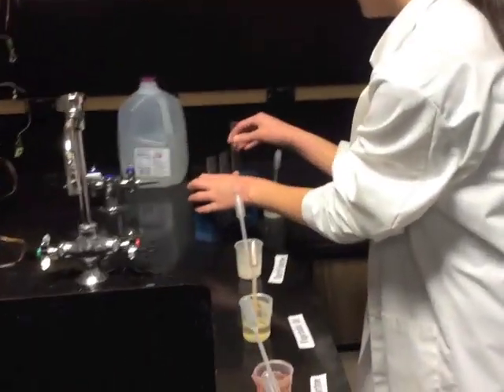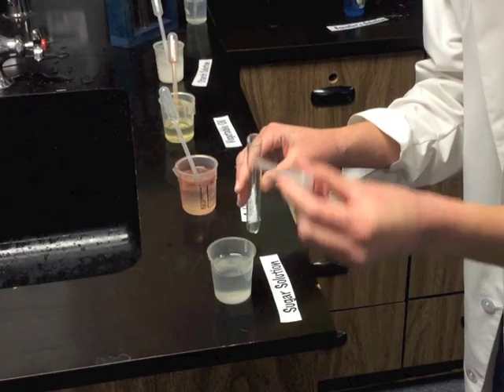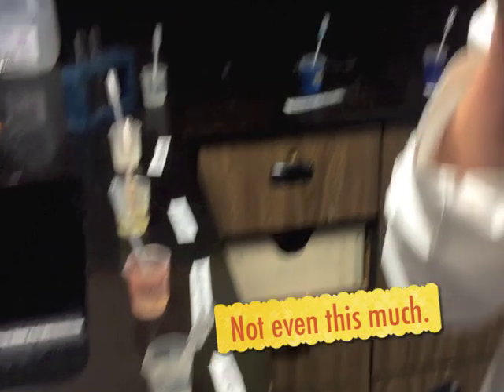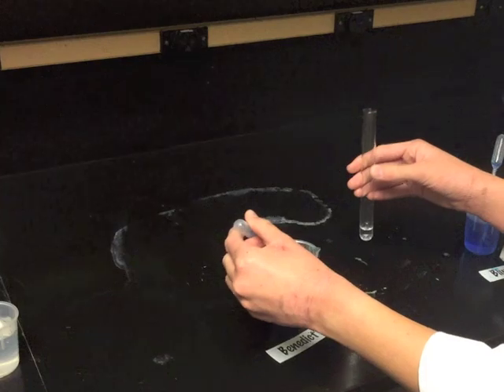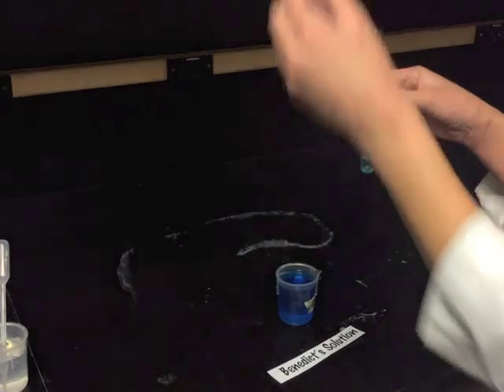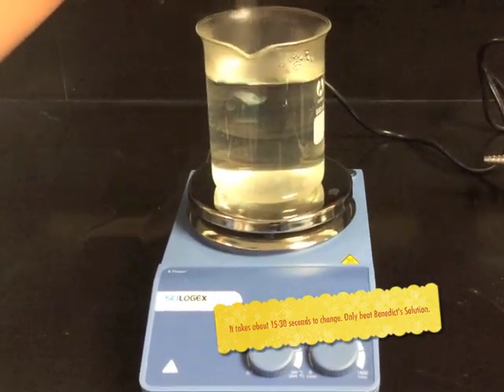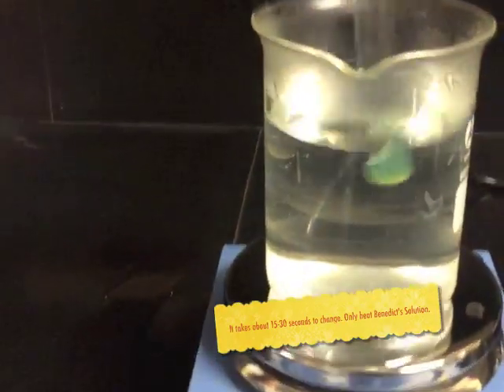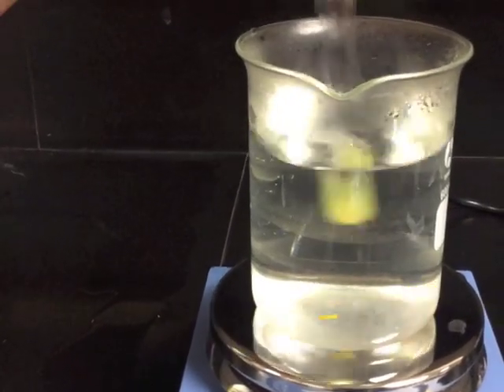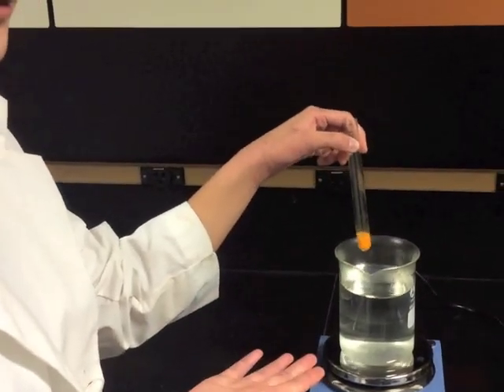First, grab a clean test tube and make sure there's nothing in it. Add a small amount of sugar solution — you don't really need that much. Then add about an equal amount of Benedict's solution. Put it in the hot water for about 30 seconds and stir it a tiny bit to help it along, but be careful. As you can see, it's starting to change color and go lighter because simple sugars are present. Pretty soon it will turn orange — and there we go. Now it is orange because there are simple sugars in it.